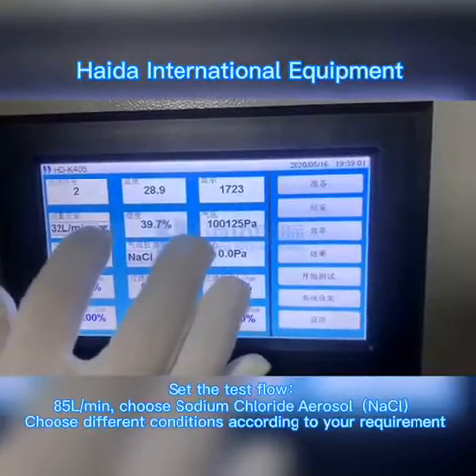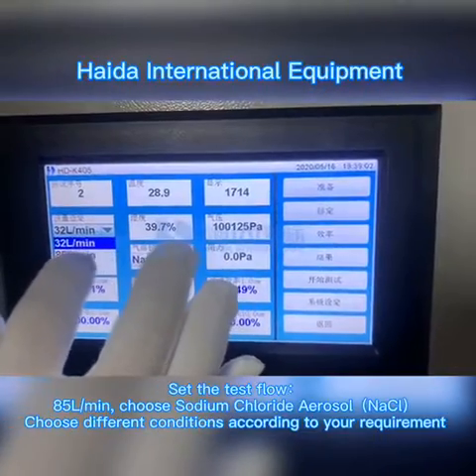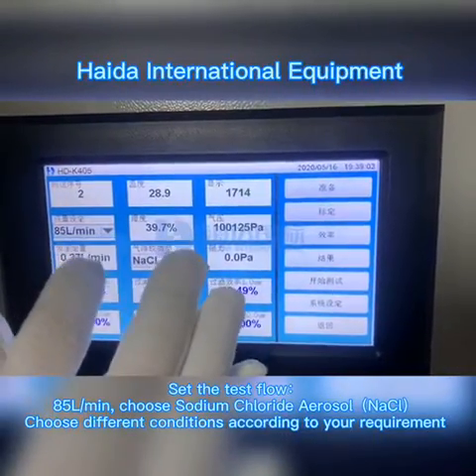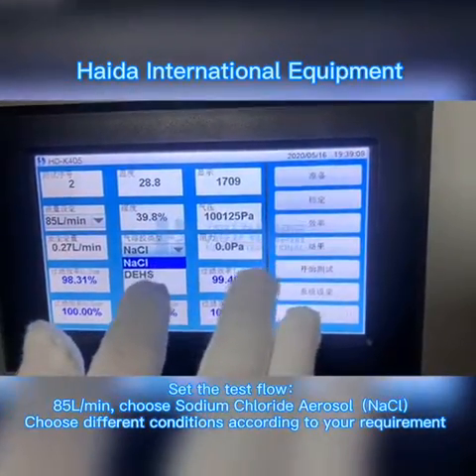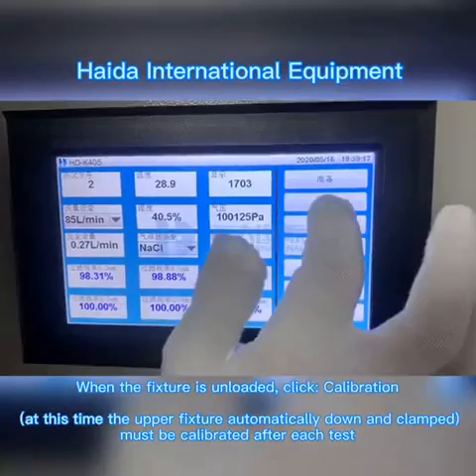Set the test flow to 85 L/min and choose the sodium chloride aerosol mode.